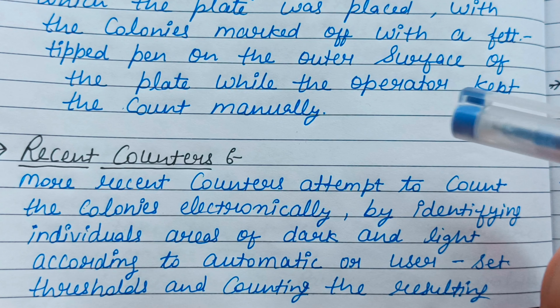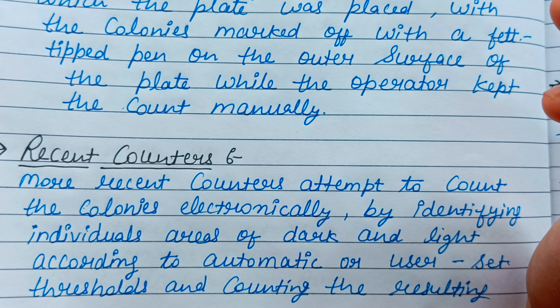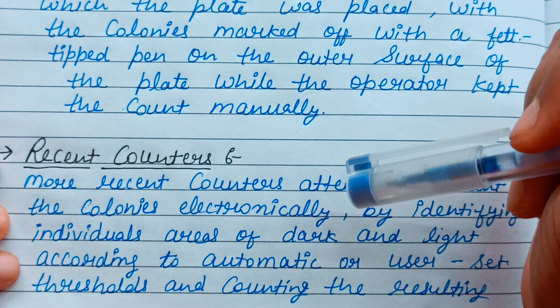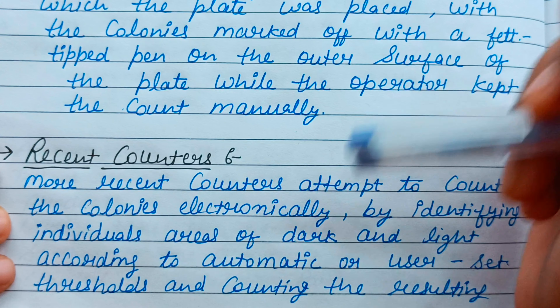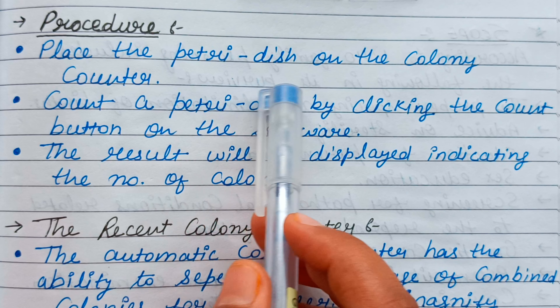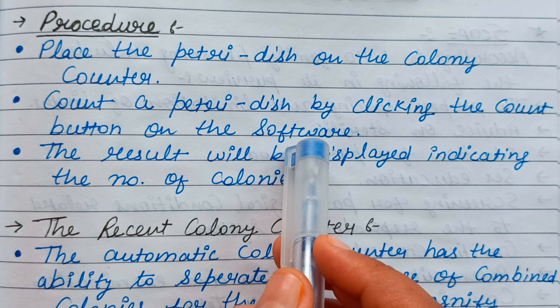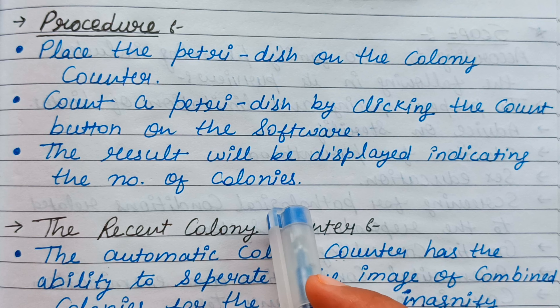Colonies are associated with preferred temperature, time, and pH level, and what happens is that the colonies automatically appear in dark and light areas and are automatically counted. Our recent counter is very useful and time spent is very little. The procedure is simple: place the petri dish on the colony counter, press the count button in the software, and the result will be displayed indicating the number of colonies.